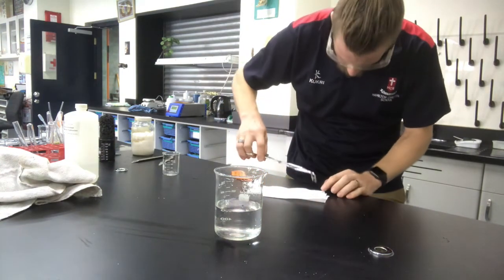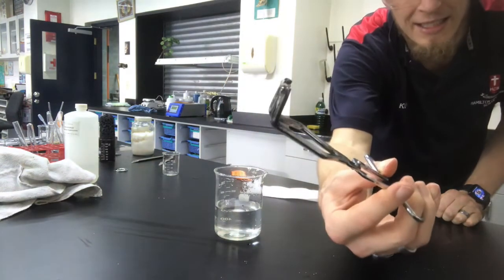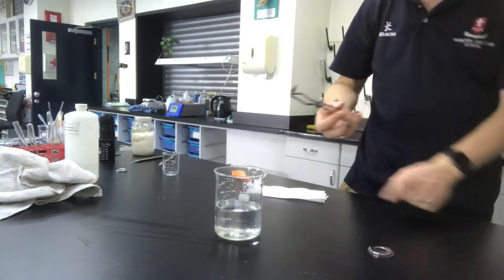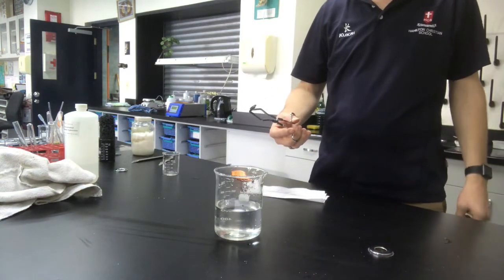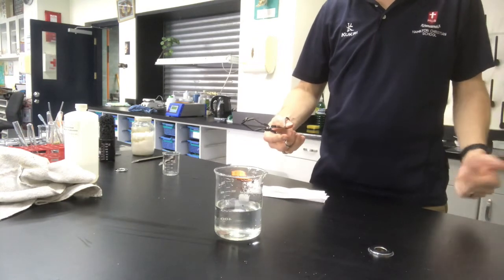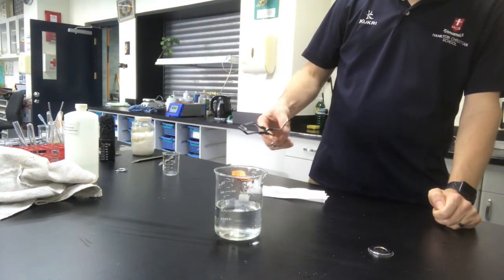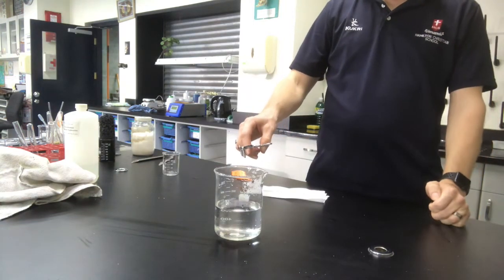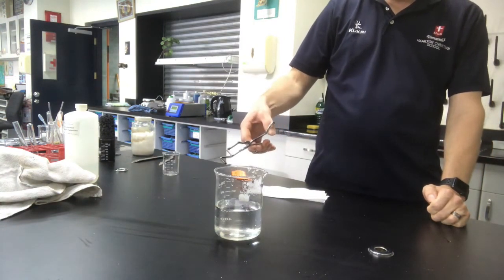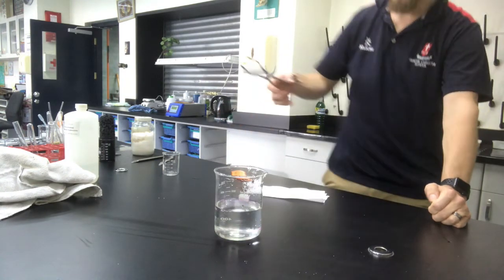Okay, so I'm going to drop a little piece here. Might be really hard to see in the camera, but I got a tiny piece there. Got my beaker with water, okay, and I drop it in, and I'm going to take a few steps back because I got new shorts on that my wife just bought me, and if I get potassium hydroxide on it, she's not going to be impressed. So I'm going to drop this in here, and then if I can, there we go.